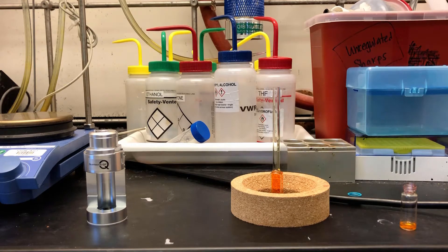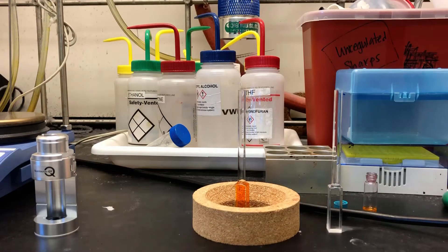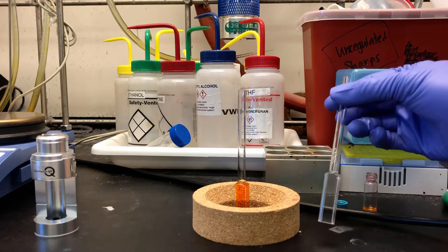We'll completely fill the cuvette before loading it in the chamber. I've also prepared a cuvette with pure THF to use as a reference.